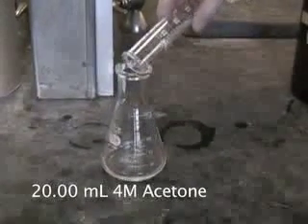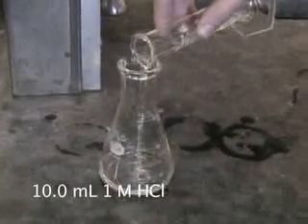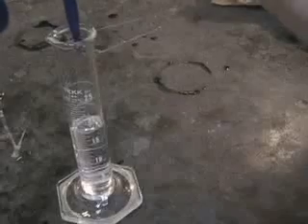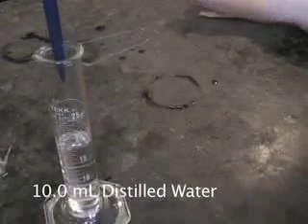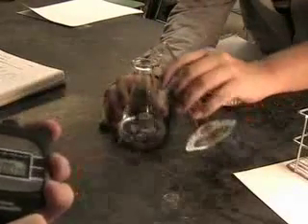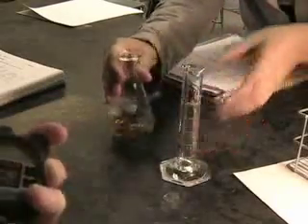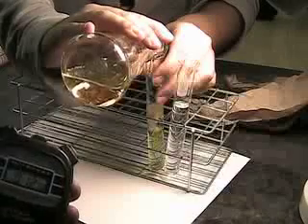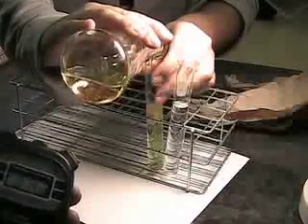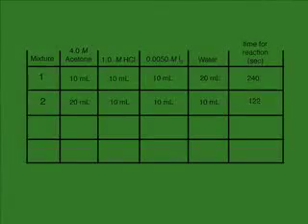We repeat the experiment, doubling the amount of acetone, using 20 milliliters. We still use 10 milliliters of hydrochloric acid, 10 milliliters of iodine, and only 10 milliliters of water to keep the total volume still at 50 milliliters. Again, we time the amount of time it takes for all the iodine to react with the acetone. By doubling the concentration of acetone and keeping everything else the same, we can determine the order of reaction in terms of acetone.